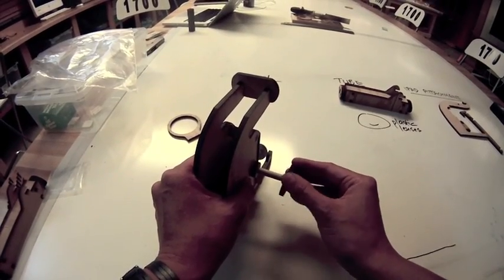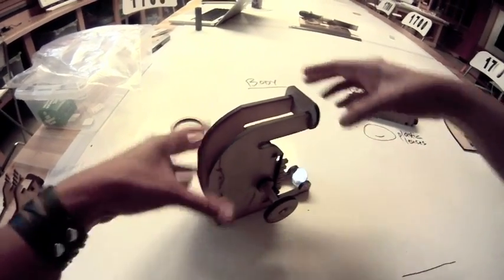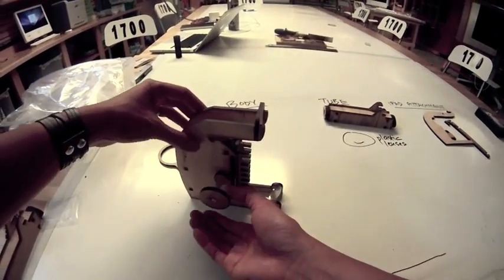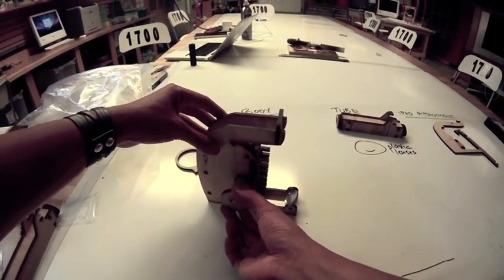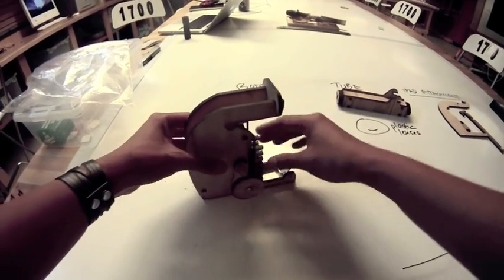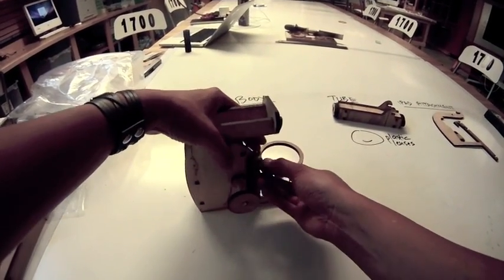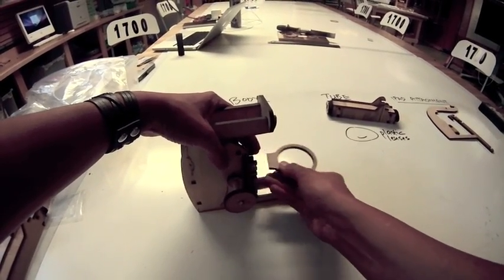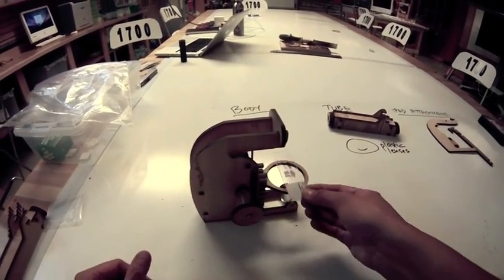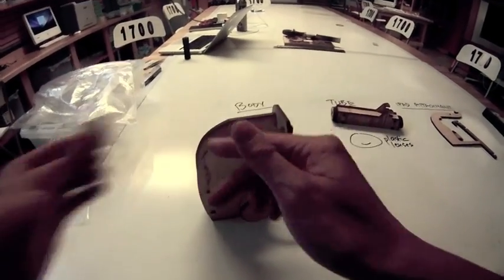Finally, we're going to put the big piece on. This big piece is just to help you turn the stage up and down — it's called the focusing knob. When you turn it, it moves the stage up and down. Make sure everything seems tight. The final part of the body is something to hold the slide, and that's what this ring is for. You can slot it into any level of the stage depending on what you're looking at.